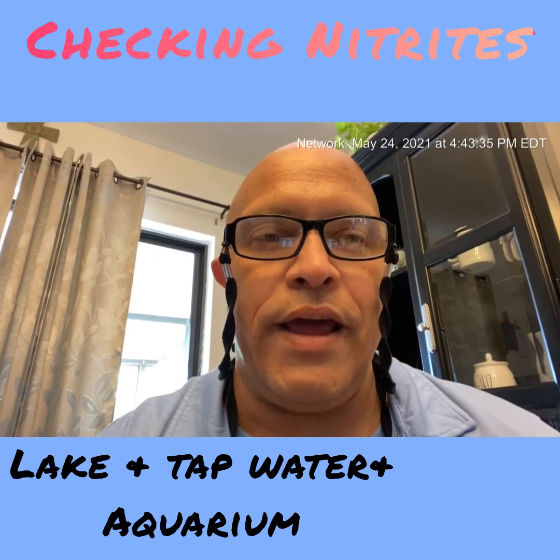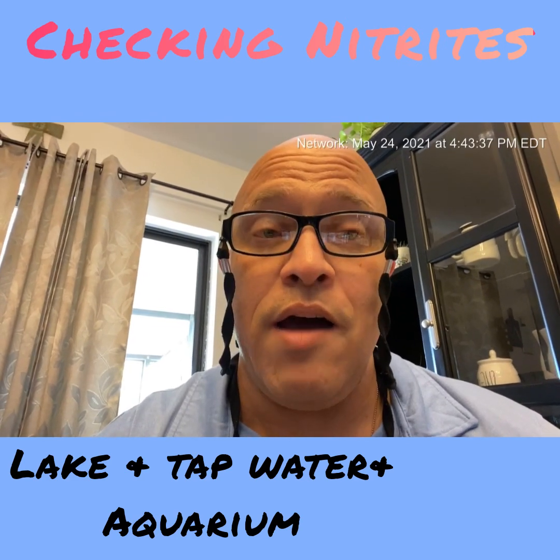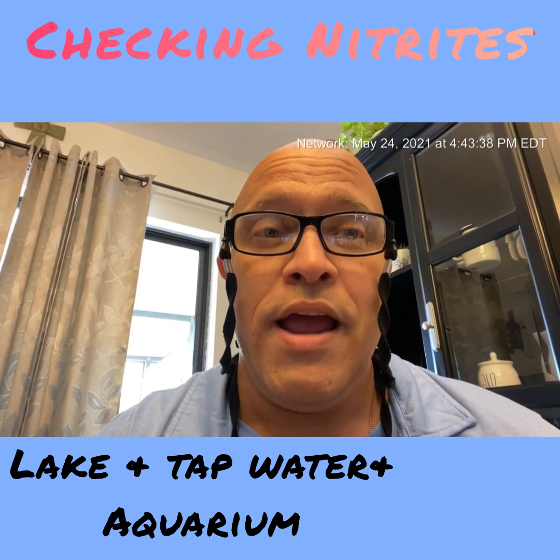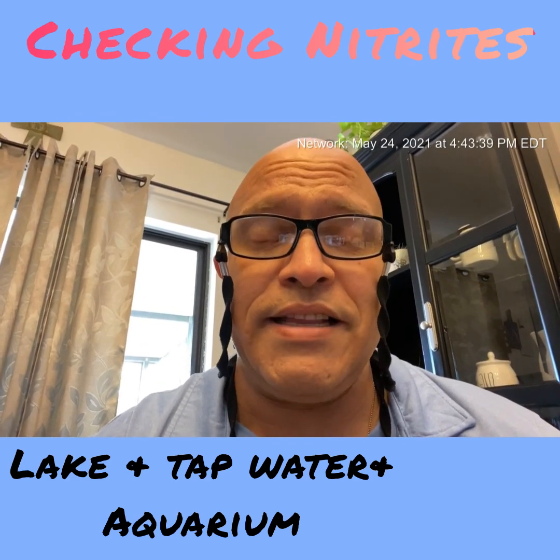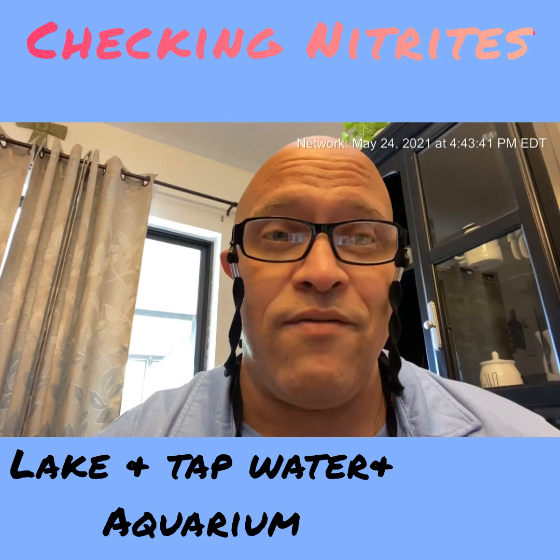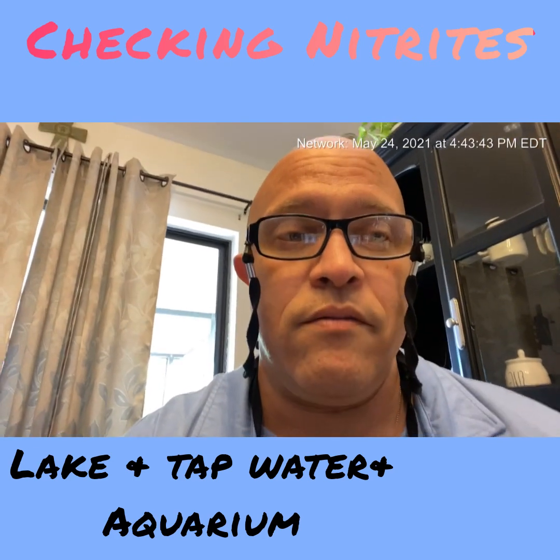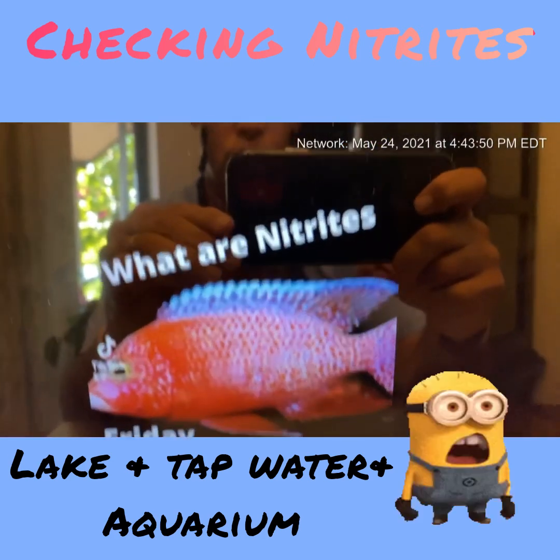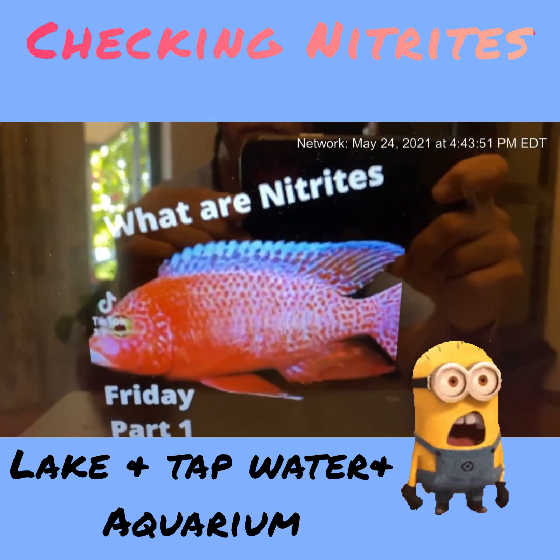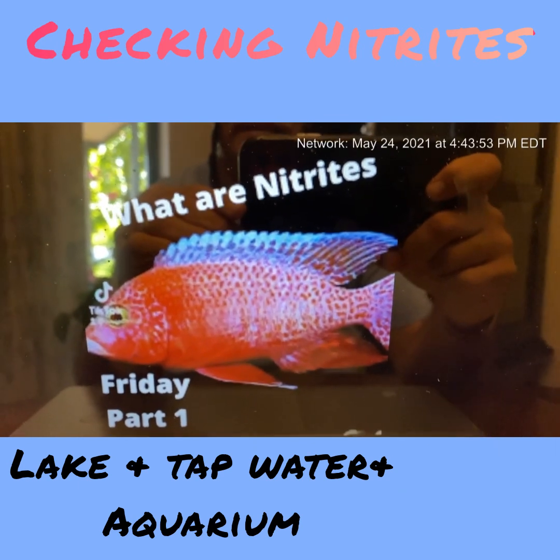We're going to be testing nitrites live — first time I've ever tested nitrites in my life. So the question of the day is: what are nitrites?